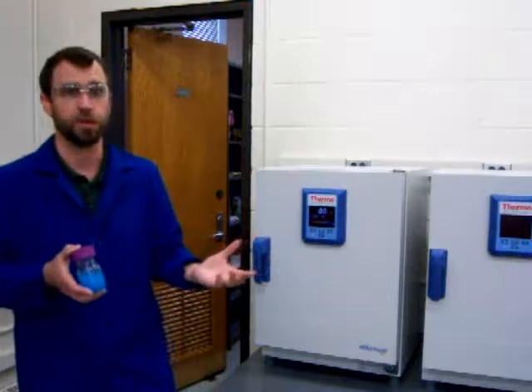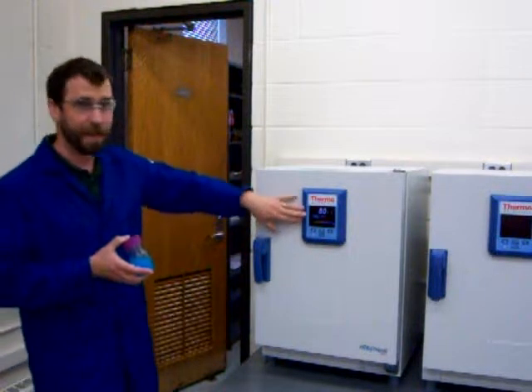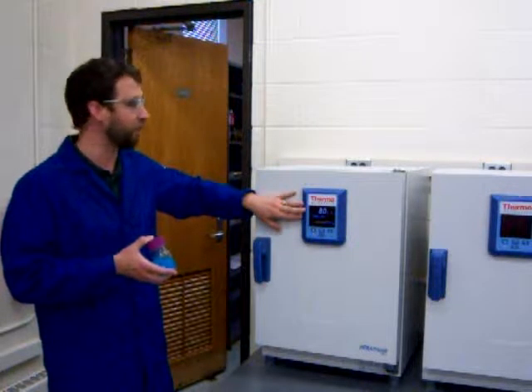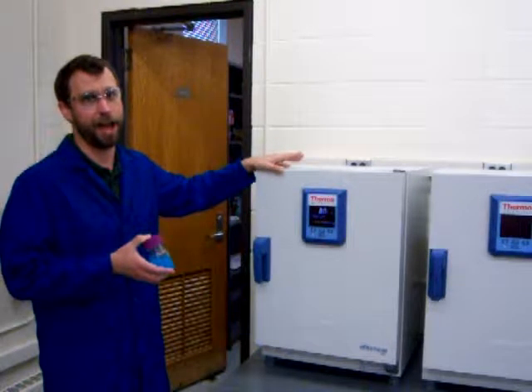The ovens that we use aren't really that different from the type of an oven that you would use at home. Although you can see we have our row of ovens here. They have fancy digital displays so that we can precisely control the temperature at which we heat our reactions. And also, they're reinforced in case anything bad like an explosion happens.